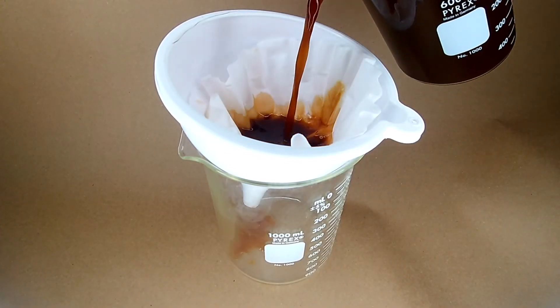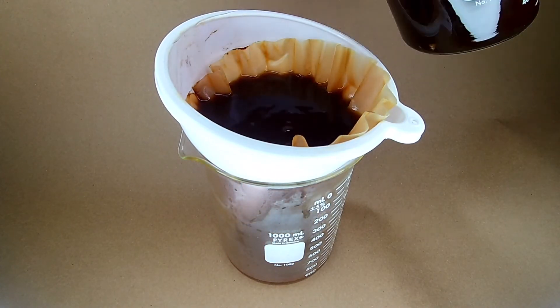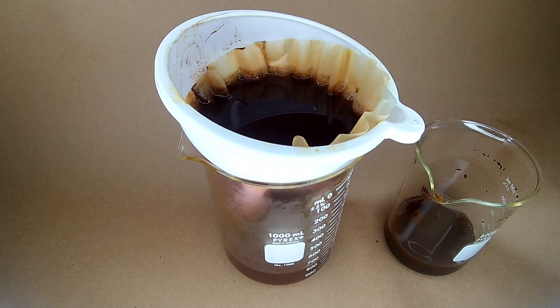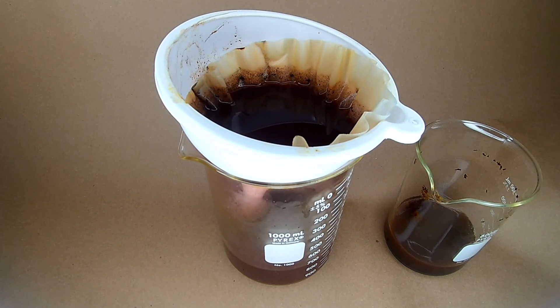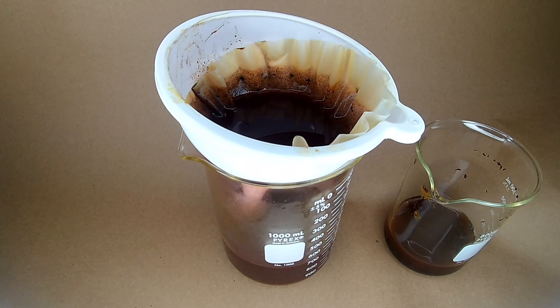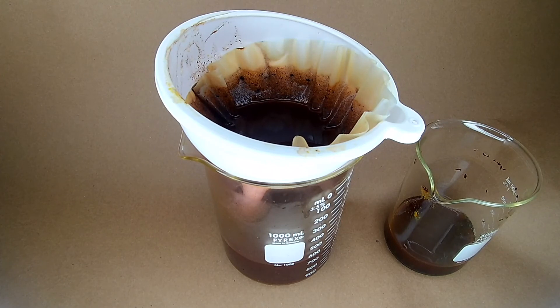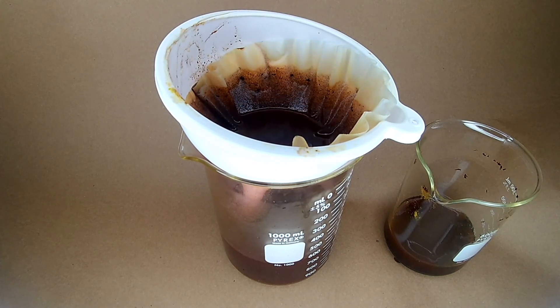The solution was then strained to see what iodine had precipitated. The iodine took a long time to strain out, and a lot of it was left in solution and not caught by the filter.